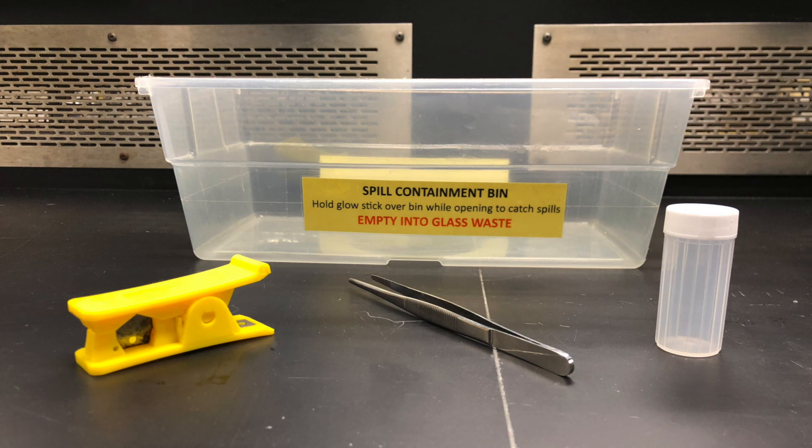For the qualitative testing, you will need a glow stick, tubing cutters, forceps, a spill containment bin, and a 20 milliliter plastic vial.